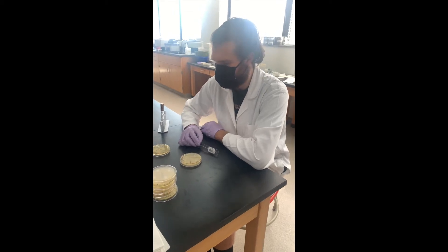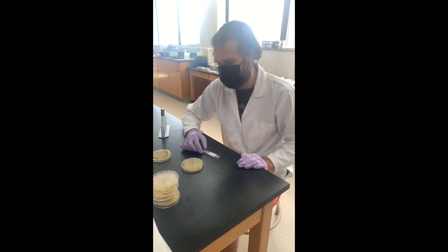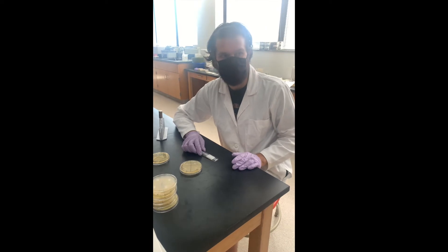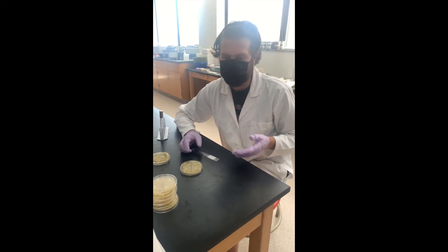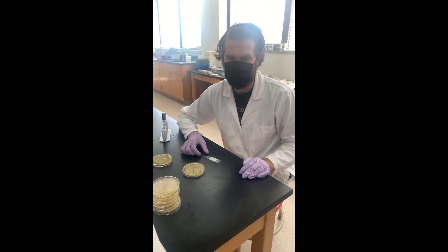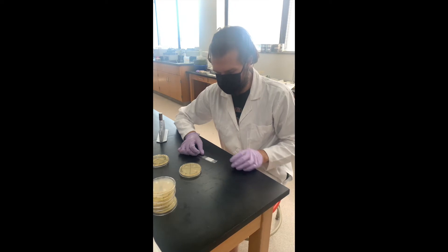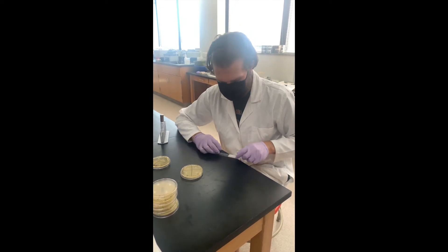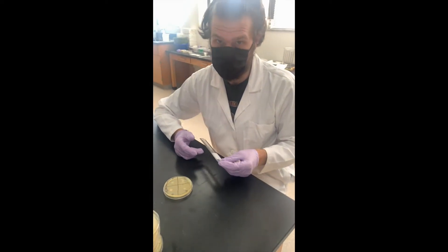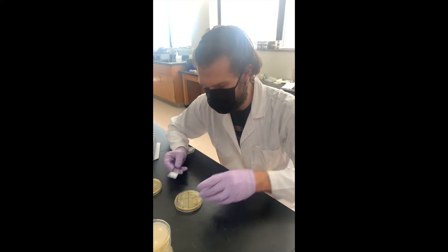So you've got a plate with some zones of inhibition surrounding antibiotic discs and you'd like to figure out how sensitive or resistant your bacteria is to these antibiotics. The way we do that is by just measuring the size of the zone of inhibition. I've got a ruler here.